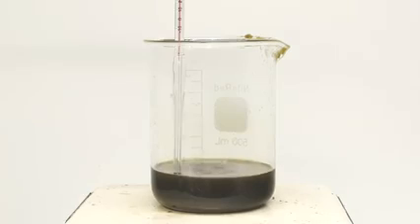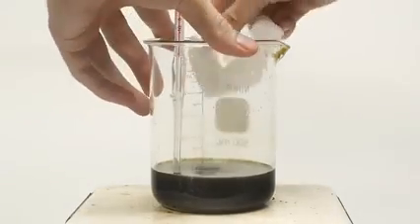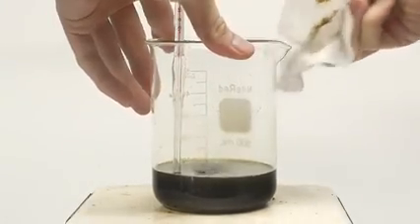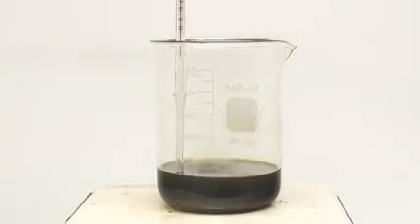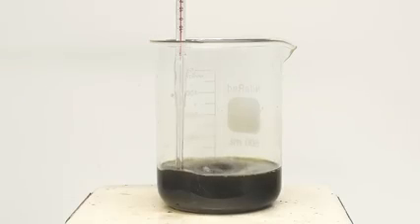I have no idea the exact composition of fatty acids I have here, so I had to assume that it was all oleic acid. Oleic acid is the most abundant fatty acid in olive oil, but it definitely doesn't represent 100%, so the numbers are going to be a little bit skewed. The amount of glycerol that I calculate is going to be slightly lower than it should be, but this isn't really a problem. For this reaction, I actually want to use less glycerol than is needed to make sure that the fatty acids stay in excess.